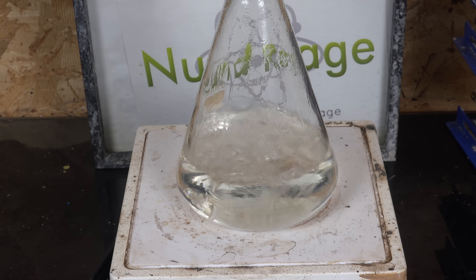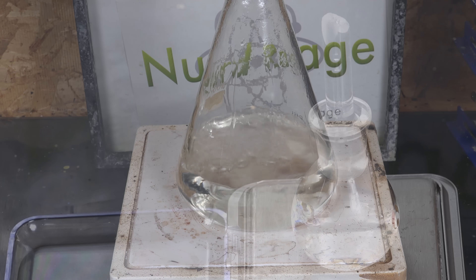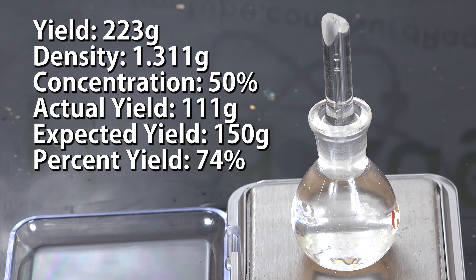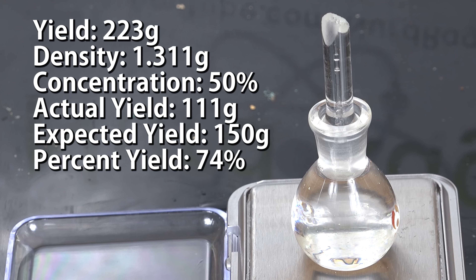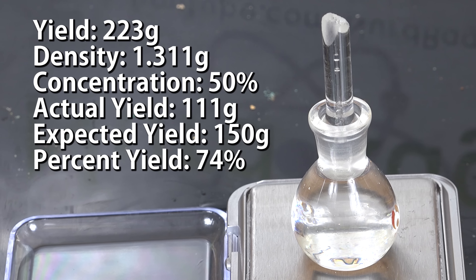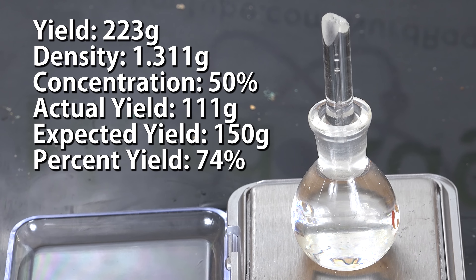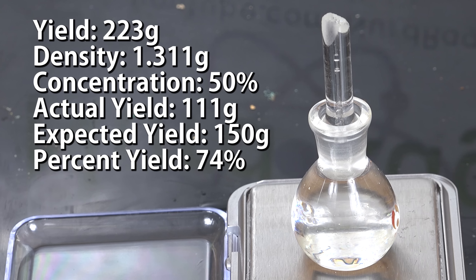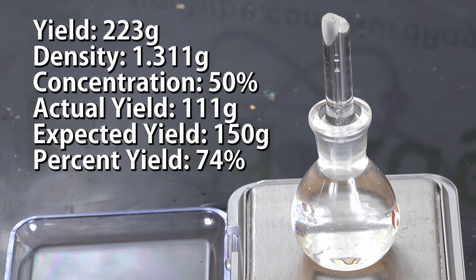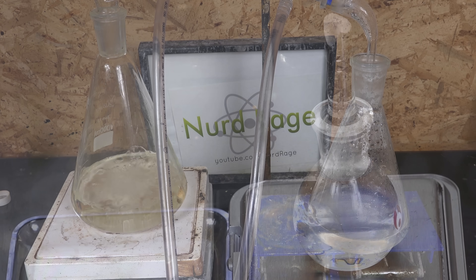If you prefer, you can do a fractional distillation and get azeotropic nitric acid directly at this point. Anyway, doing our density check, we have a collected product of 223g of nitric acid at a density of 1.311 g/mL for a concentration of about 50% at this temperature. That gives us an actual yield of 111g of nitric acid out of an expected 150g, or about 74% yield. This is actually an excellent yield for such a crude process.